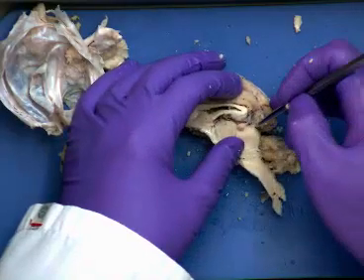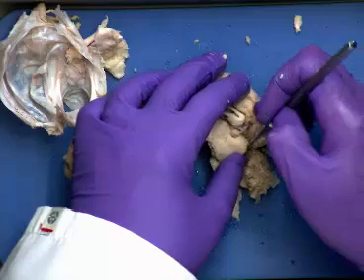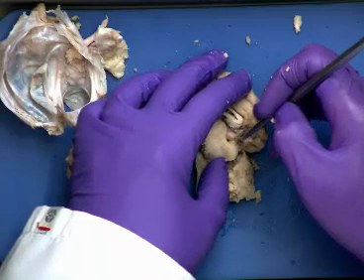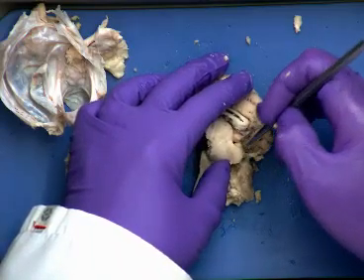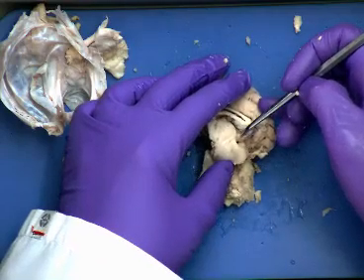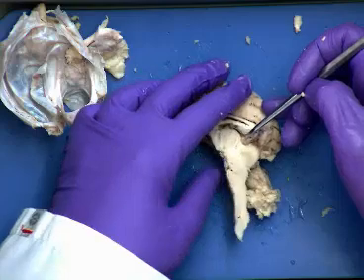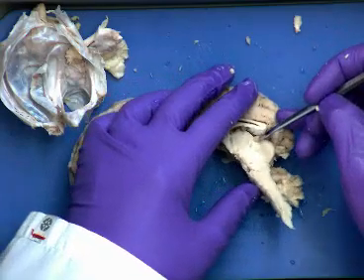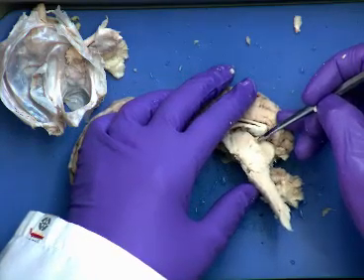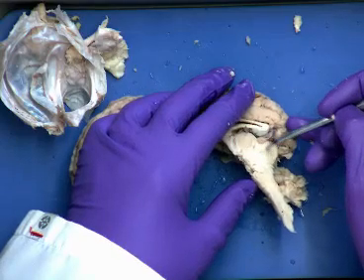You'll also notice that little dark structure right there? That little ball that you get right there, which technically if you were coming in here and viewing from the posterior side, we can see how it kind of separates. That ball that we see right there, that's the pineal gland. The pineal gland releases melatonin that we said works to coordinate our sleep and wake cycle with day and night. So that's our pineal gland. That was our corpora quadrigemina, that's our thalamus.